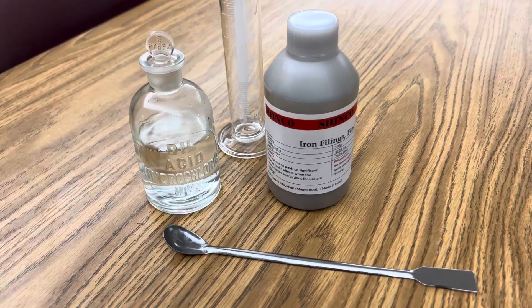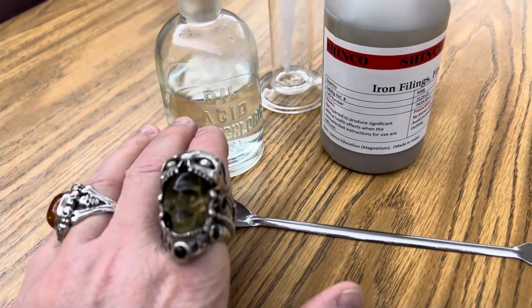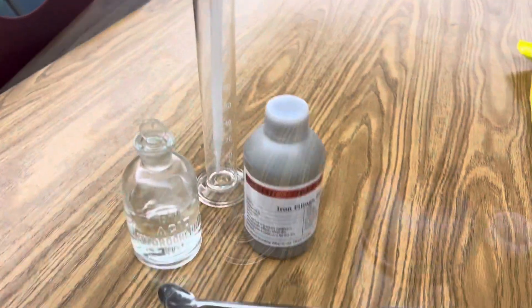All you need for this reaction is some 12 molar hydrochloric acid, your iron filings, and a graduated cylinder.